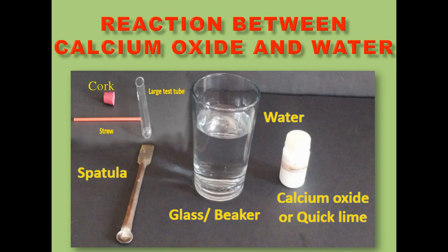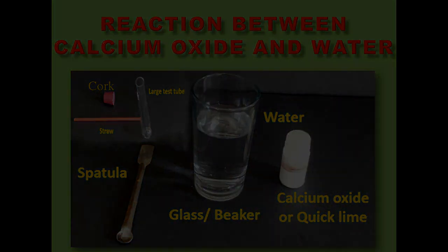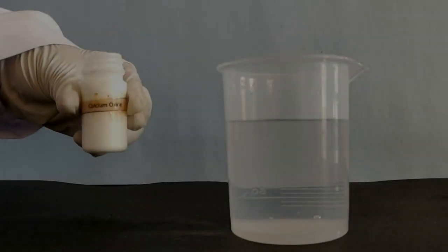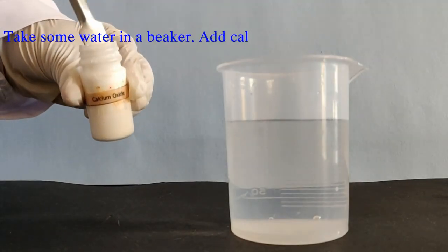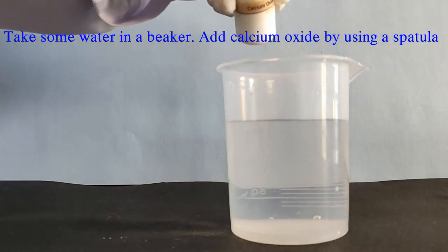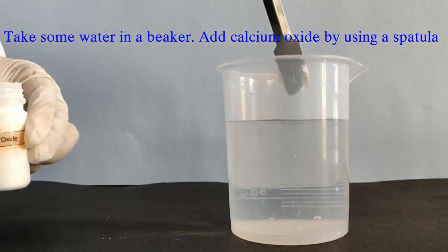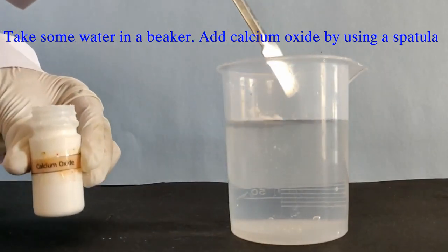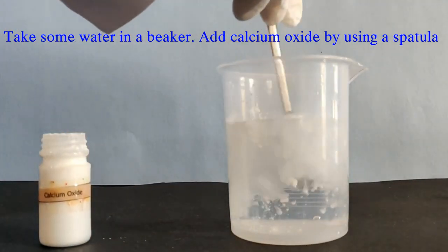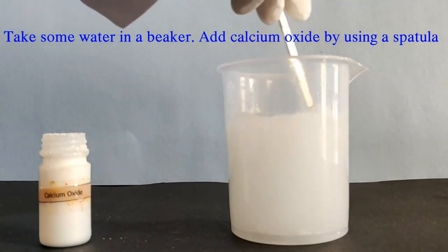We have to arrange these to perform the activity. Take some water in a beaker and add calcium oxide by using a spatula.